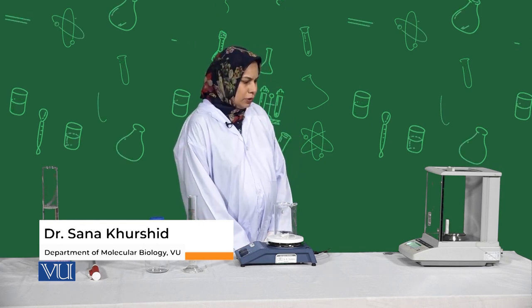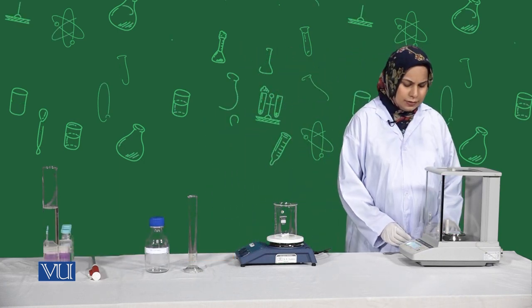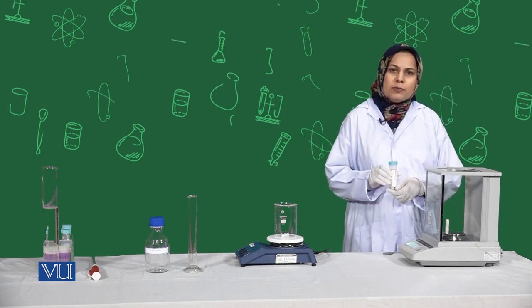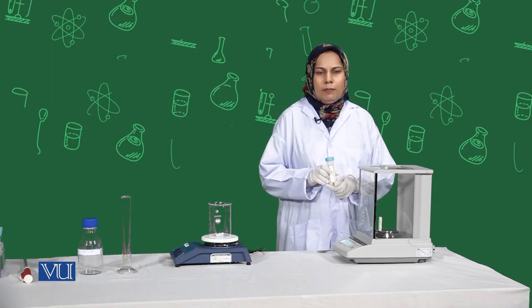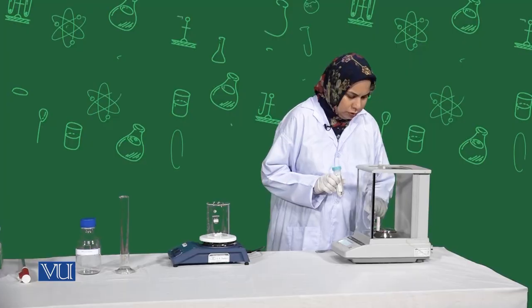Dear students, the next solution preparation is about 50X TAE solution, used for electrophoresis. For this preparation we need 24.2 grams of Tris base, 5.7 ml of acetic acid, and 10 ml of 0.5 molar EDTA solution. First, we are going to measure the Tris base powder. Put the weighing paper on the balance, tare it, and when it becomes zero, add Tris base powder equivalent to 24.2 grams.